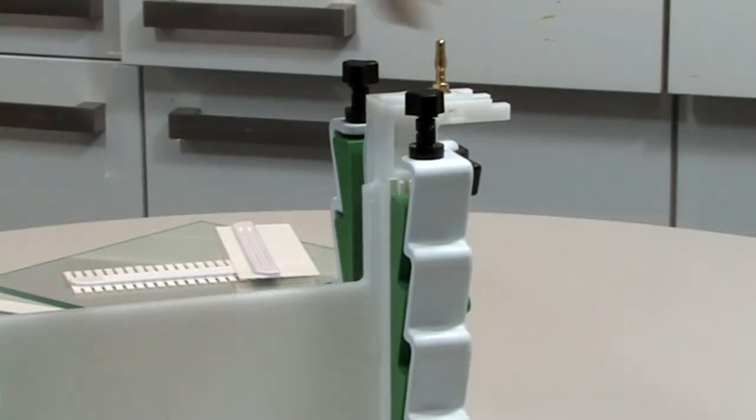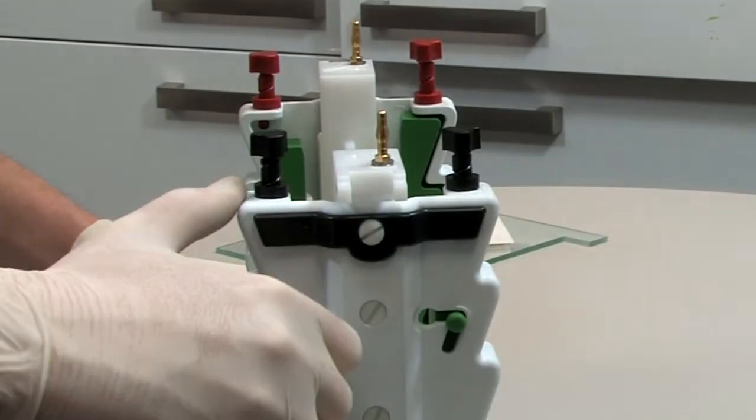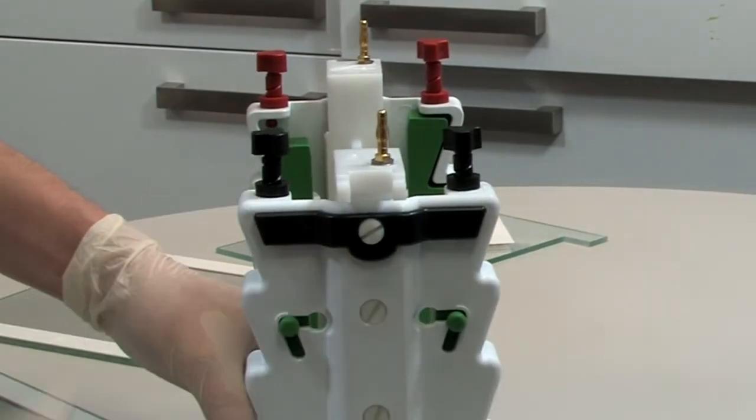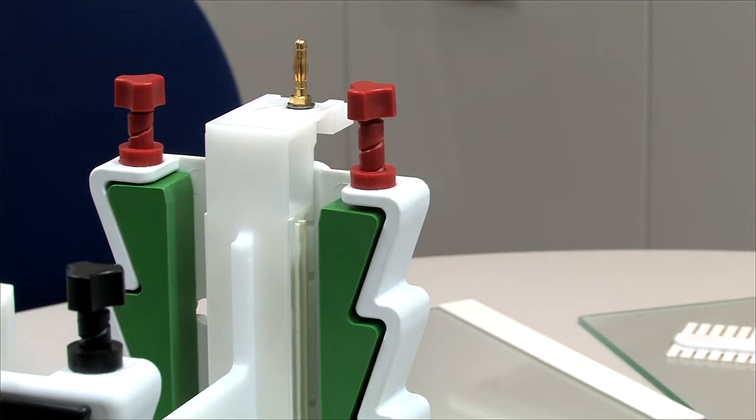Unscrew the red and black screws in the upstand to release the locking mechanism, allowing the green gel clamps to sit in the resting slots.